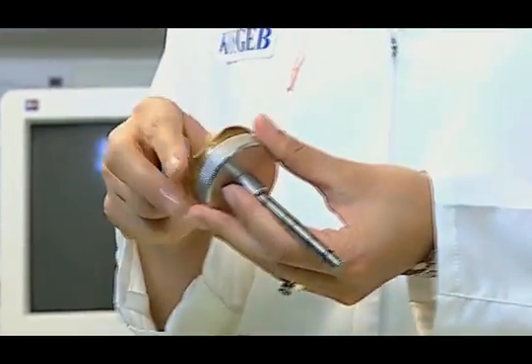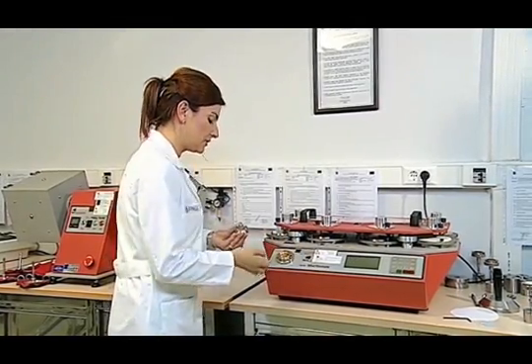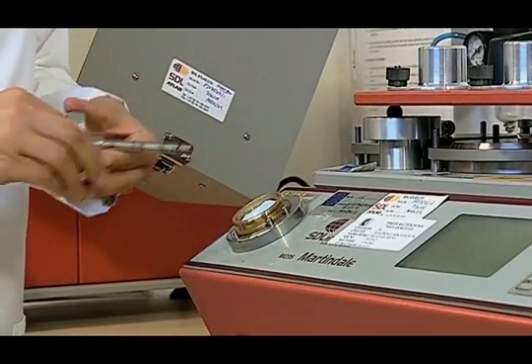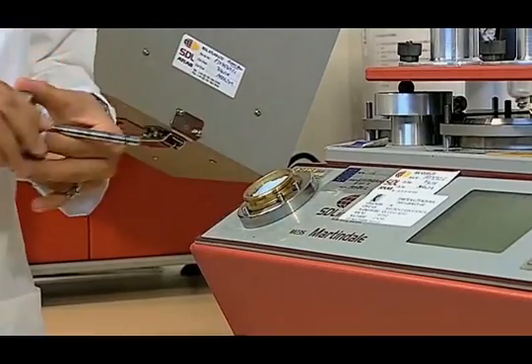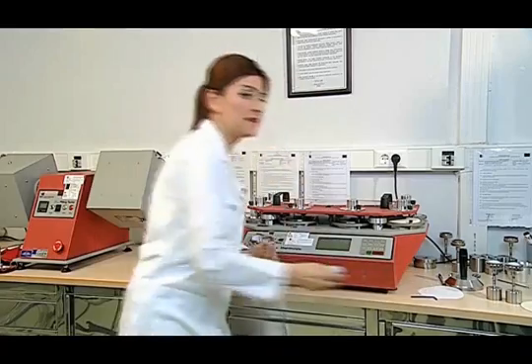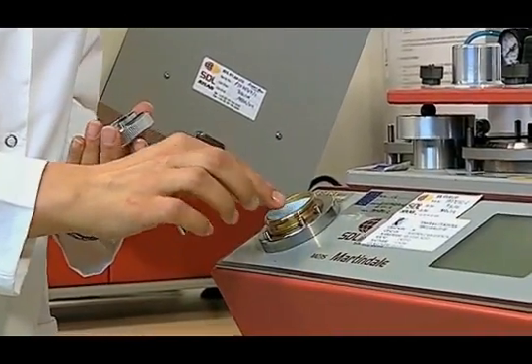The samples that are cut are placed in the sample holder to start the test. 38 mm wide samples are attached to the sample holder by removing the collar of the sample holder from its slot. The sample is placed into the collar with its front side facing downwards. If the sample is lighter than 500 g per square meter, foam is inserted — also cut to 38 mm.